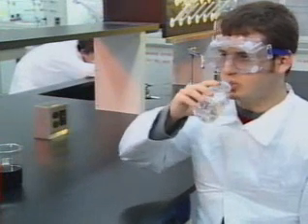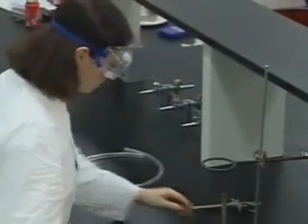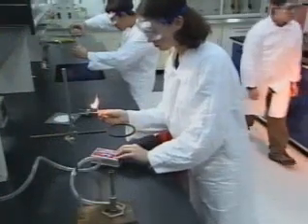Well, he seems to be recuperating a bit, and our action really seems to be heating up. Yeah, and speaking of heating up, over there is somebody getting ready to light a Bunsen burner. Oh, she sure is. What do we need to look for here? Look for an explosion if you do this wrong. The most important thing to remember is to light the match before you turn the gas on.